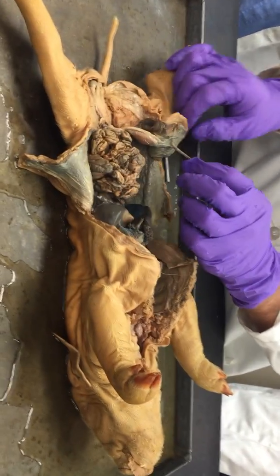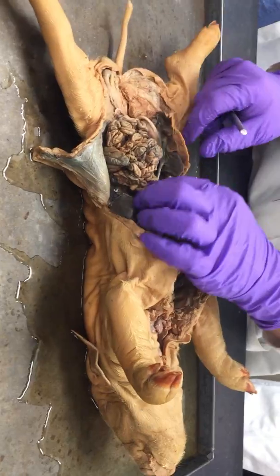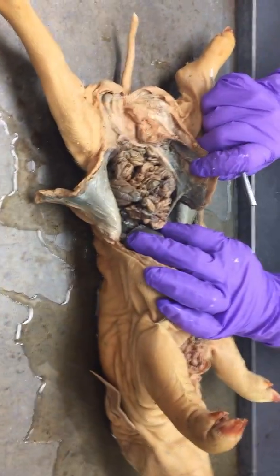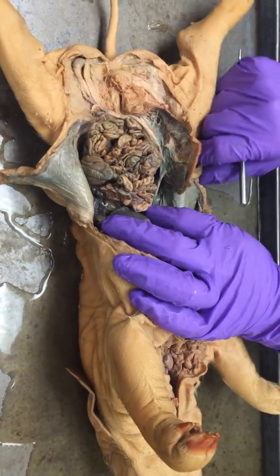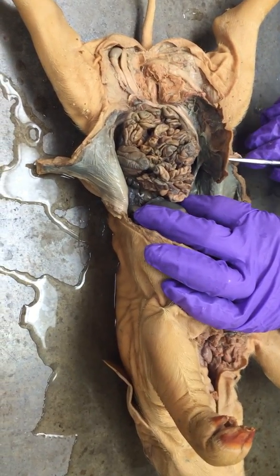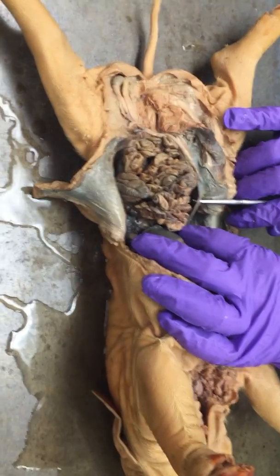This is from another class, like a freshman class. But this is sort of, and you can maybe catch it on the film, the default orientation. So fetal blood, oxygenated fetal blood, is coming in through the umbilicus and then goes into this structure.